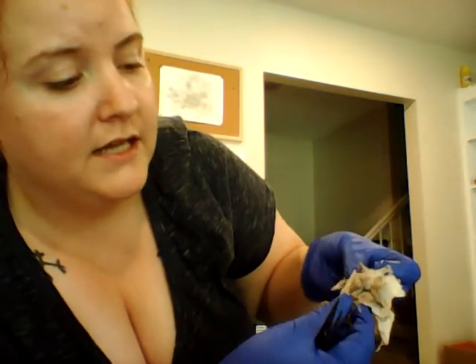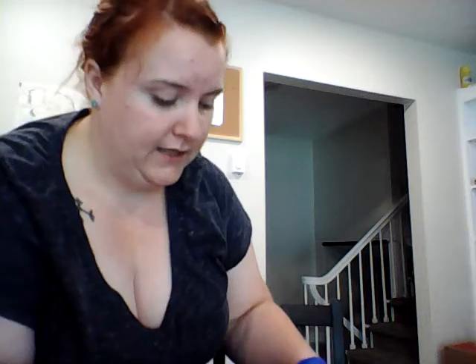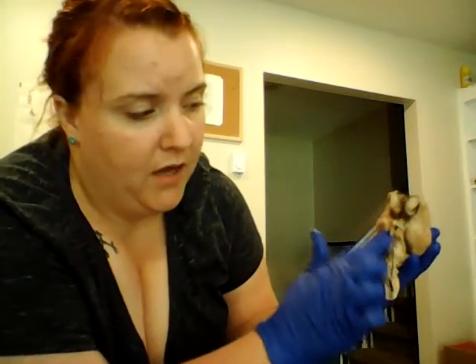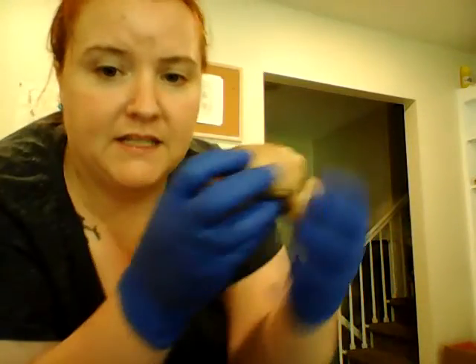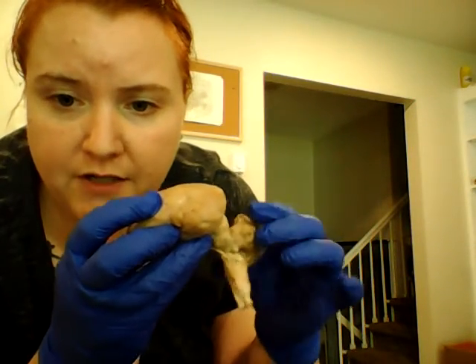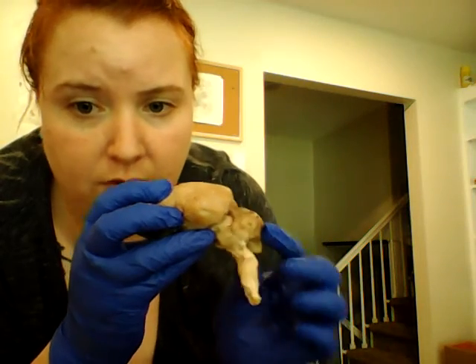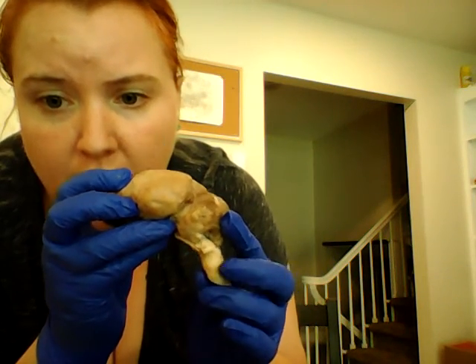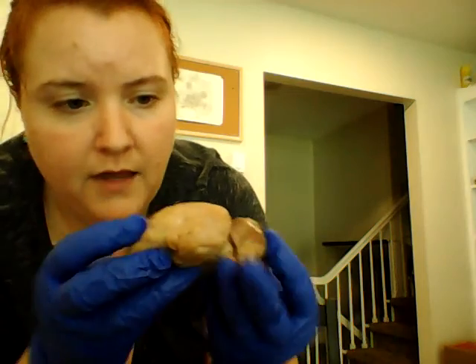So just a heads up that when you're looking at it together, that's not exactly the same as what you would see normally. And normally all those structures go right in here. But if you're looking at the brain this way, like I mentioned before, you have your cerebellum here, and then you have your medulla oblongata here, if you're looking at the brain like that. That's all.